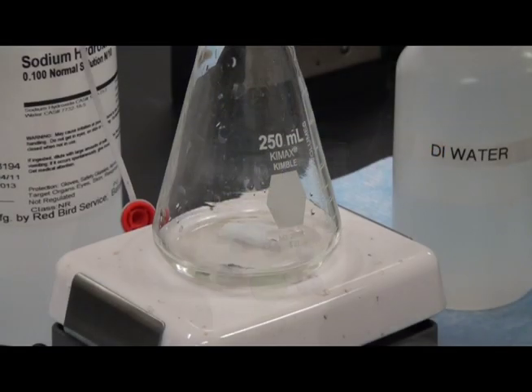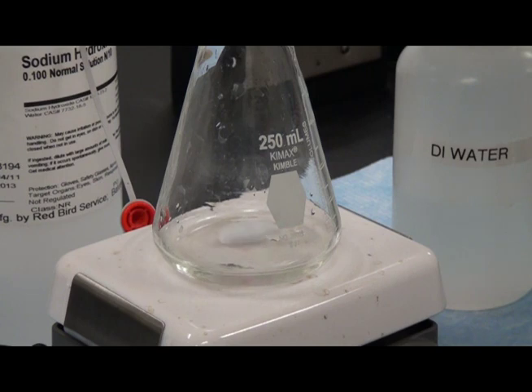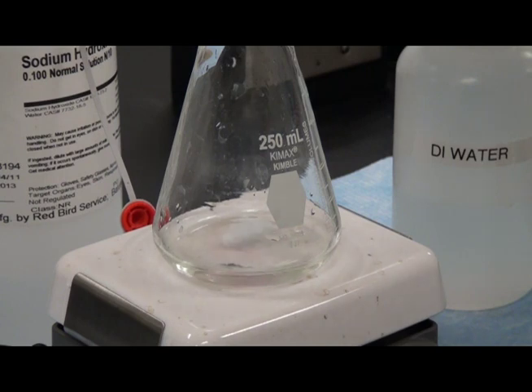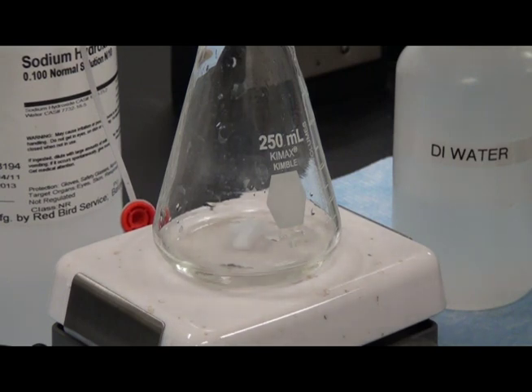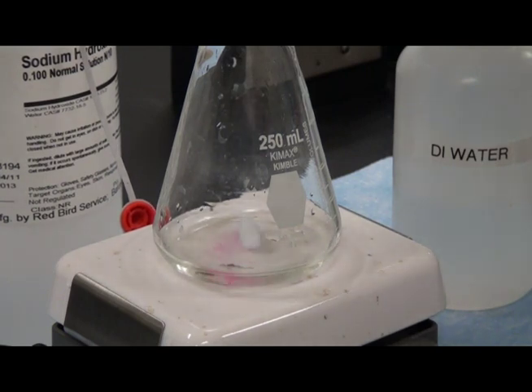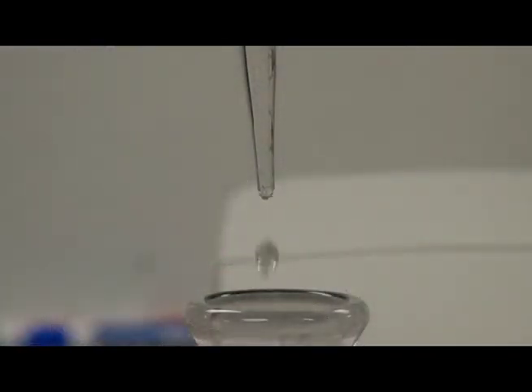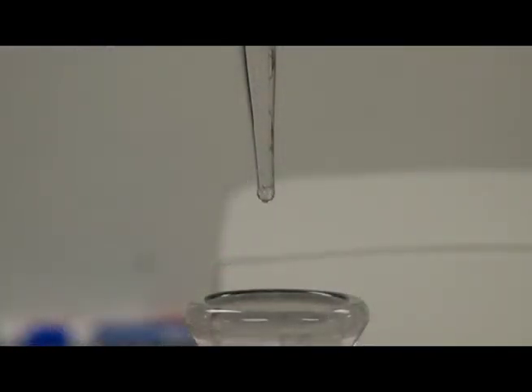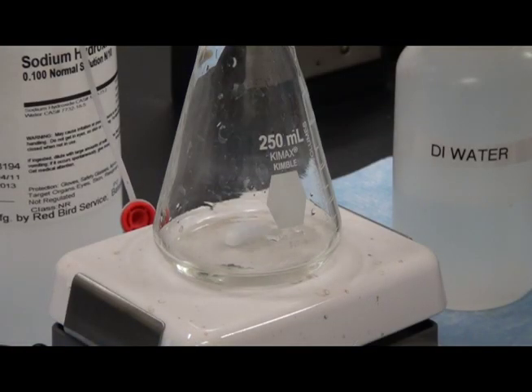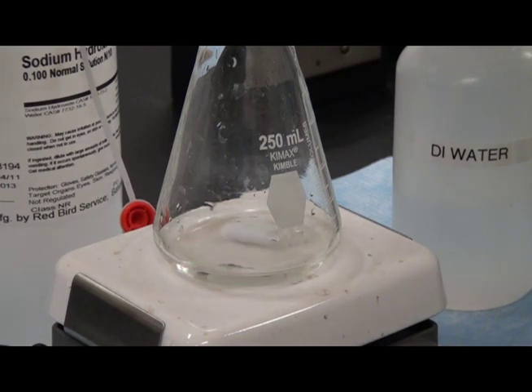Generally, the lower the pH, the higher the acidity in the wine. However, there is no direct connection between titratable acidity and pH. It is possible to find wines with a high pH for the wine and high acidity.